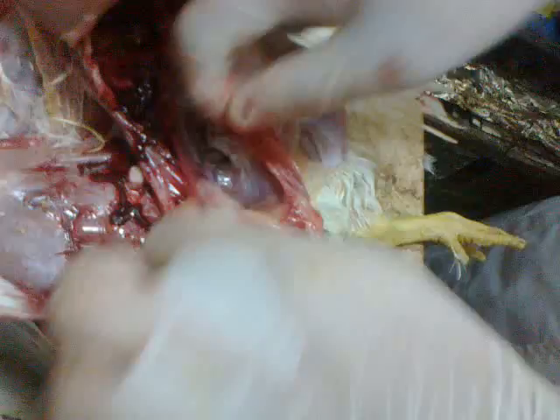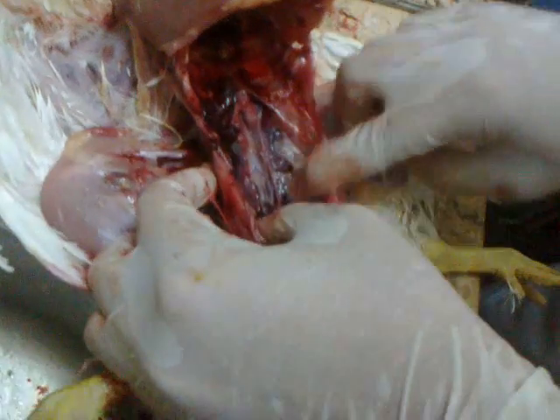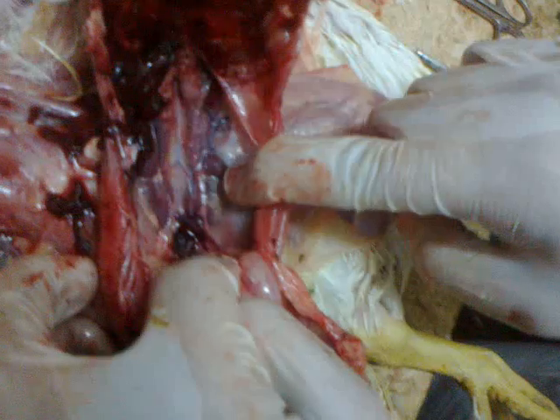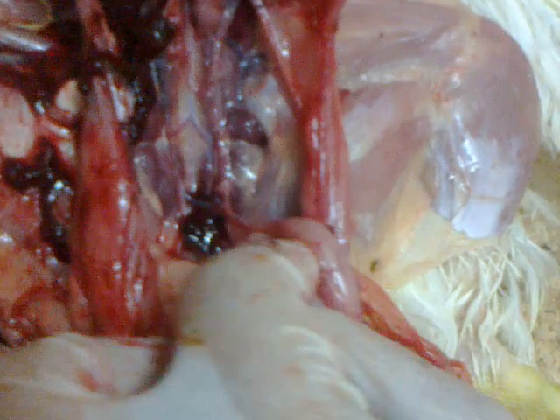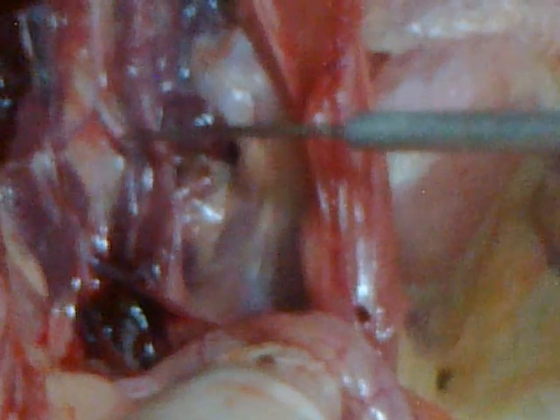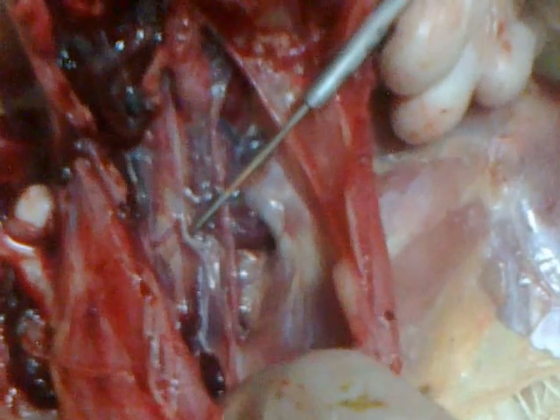This is the intestine. Before examining the intestine, here is the kidney. The kidney normally consists of three lobes, which are not supposed to be visible normally, but here we can see them — seeing them indicates nephritis. This is the ureter, also normally not seen. Seeing it, especially if there is white precipitate in it like this, indicates nephritis due to drug administration, salmonellosis, or mycotoxicosis.